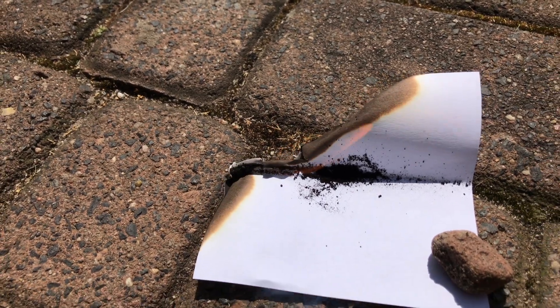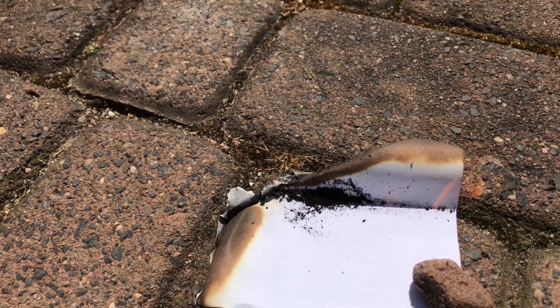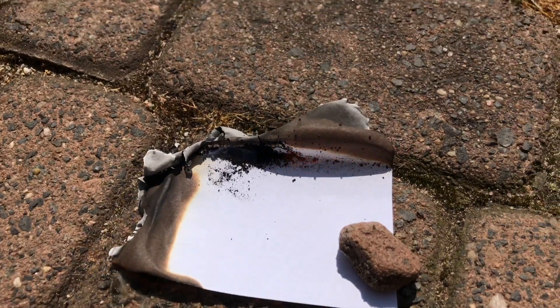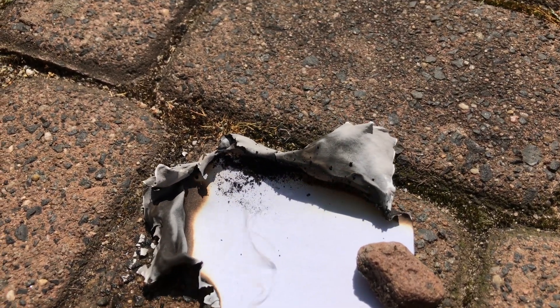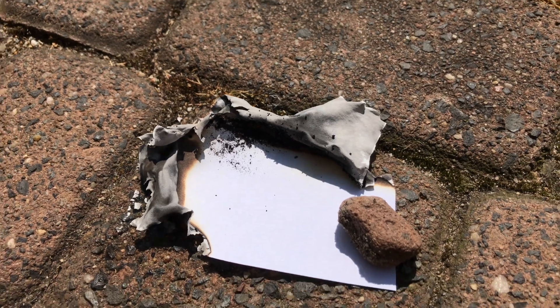You want to see some fire and therefore I'm going to show it to you. This is potassium ferrate on a piece of paper and I lit it up. Unfortunately it does not look like it's a strong oxidizing agent and I don't know why.